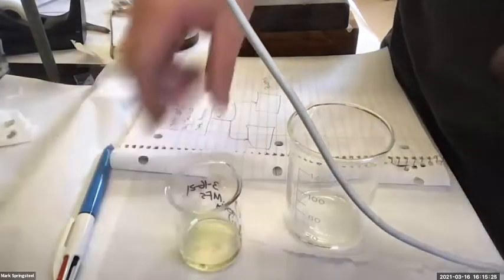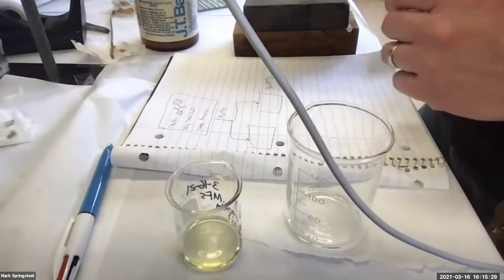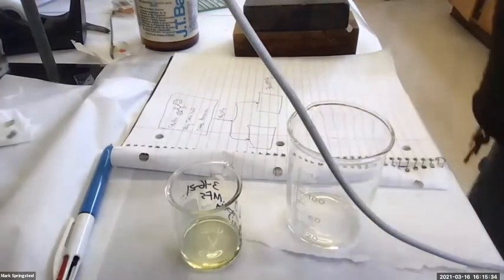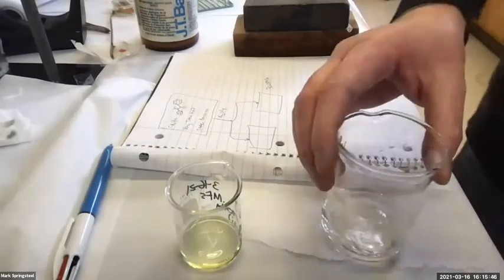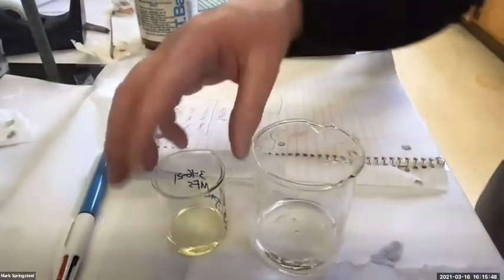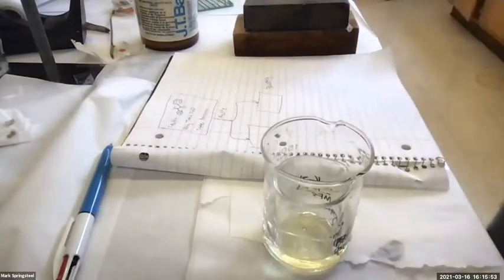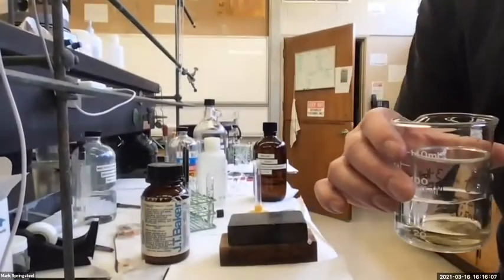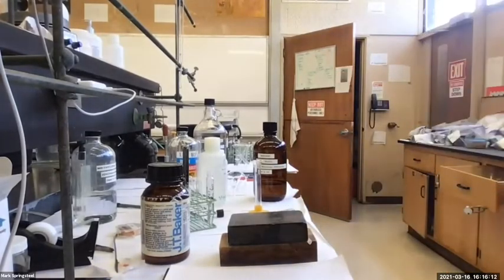And while this is evaporating, I'll go back to the aqueous layer from the extractions earlier. I'll get the benzocaine out. So let me get some of that warm water I was telling you about. And I'm just going to put a little bit in here. Like this. That works good. And I will bring this over to the fume hood behind the computer here. Just set it somewhere where there's a good airflow. It'll evaporate a little bit quicker in there.